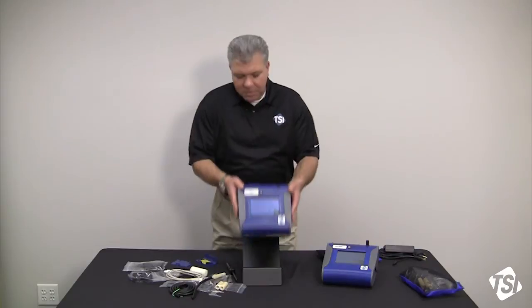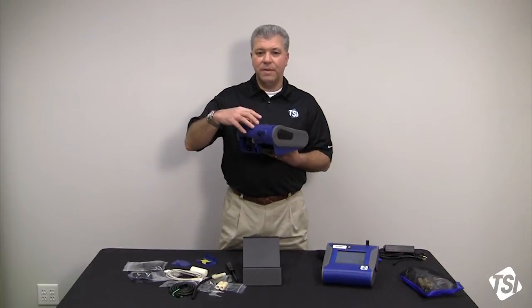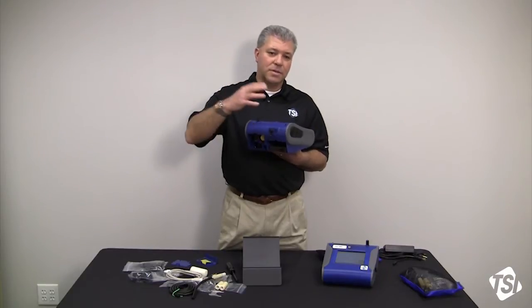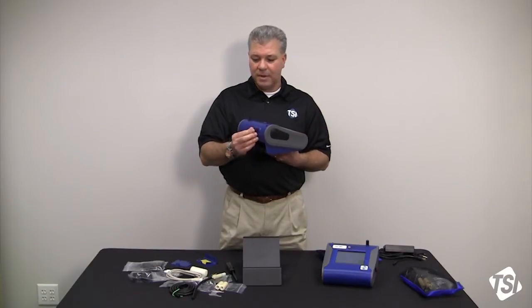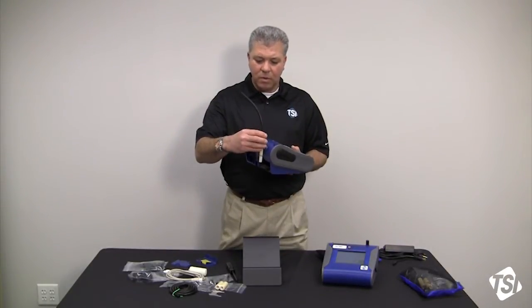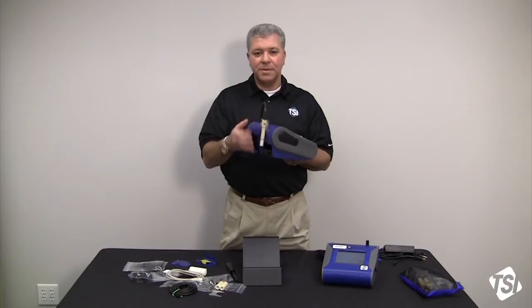On the back side of the instrument you also have an auto zero port. There's an auto zero module that fits on top of the DustTrak which then plugs in here, and that's where it gets its commands to turn on and off so that you can auto zero during long periods of sampling. Right next to that you have a bracket, and that's what holds the dorr-oliver cyclone captive so that you can do respirable work area monitoring.